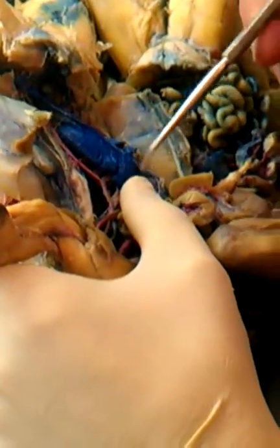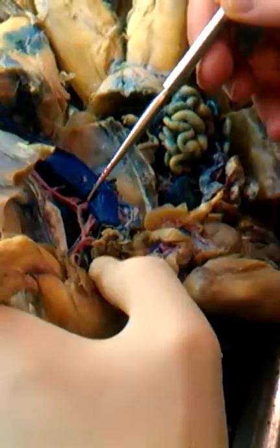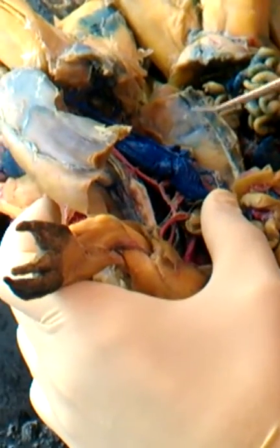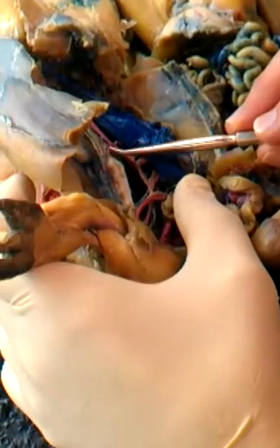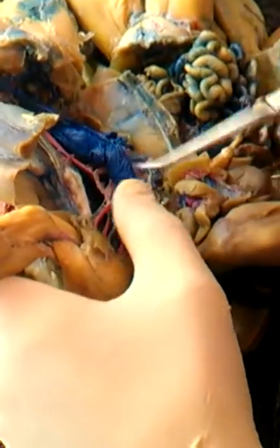Okay, continuing on. Flip the gonad back here just a minute. And flipping even the kidney back. The kidney is the big blue structure. What we see is a number of parallel vessels going to the kidney, and those are urogenital arteries. Well, some of them go to the kidney, some to the gonads. At the same level, but going to the back musculature, are lumbar arteries. Now, some of these have been torn, but you can see some of these right here. They're right at the same level, but the key thing is where they go to. So urogenital to the kidneys, lumbar arteries go to the back muscles.